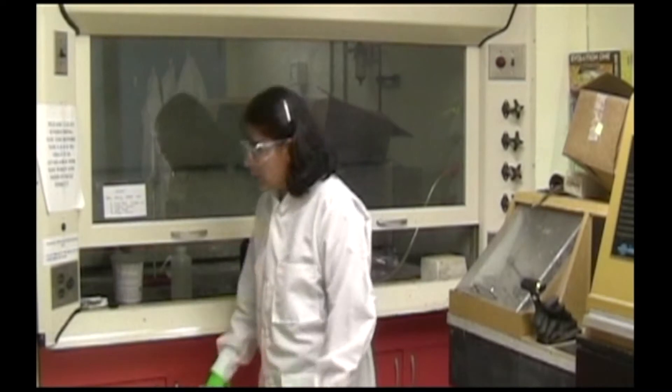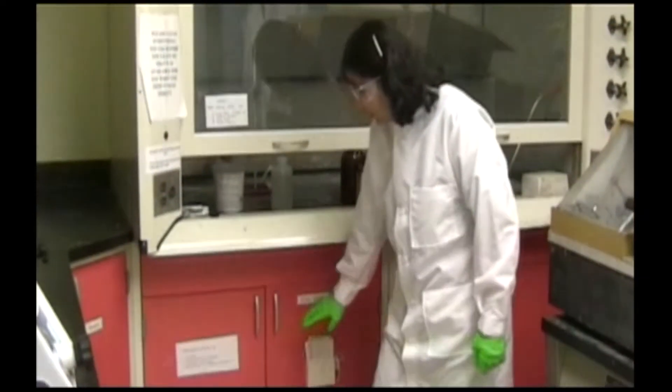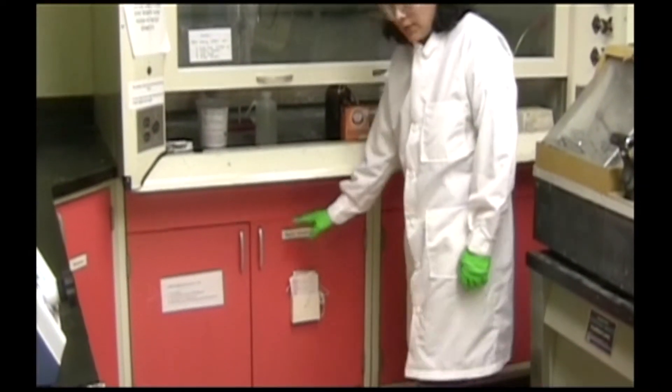There are solvents kept in this cabinet, acidic etchants should be kept in this cabinet, and basic etchants over here.